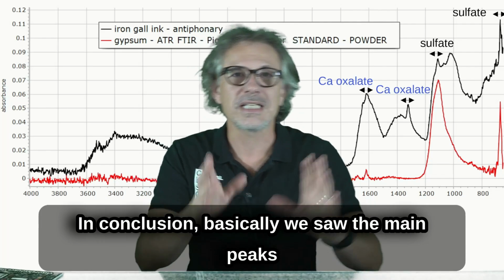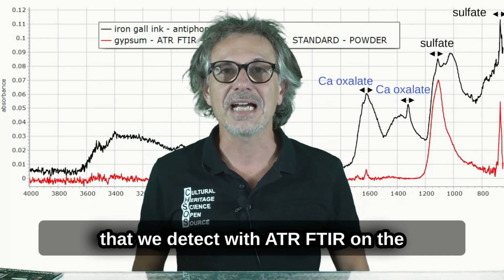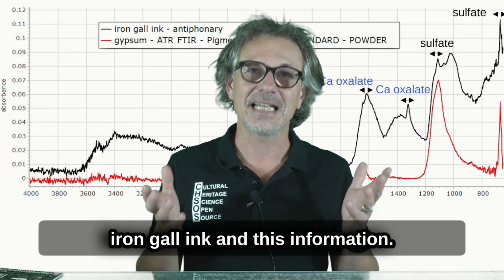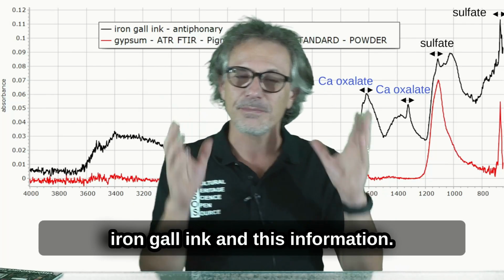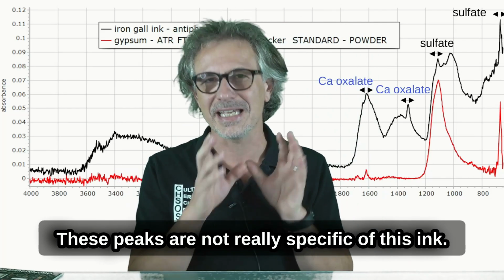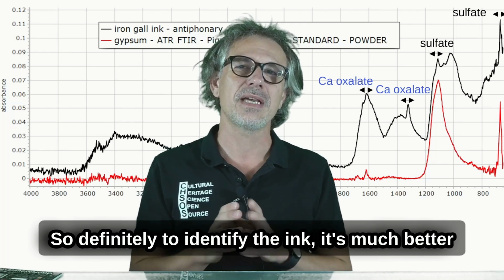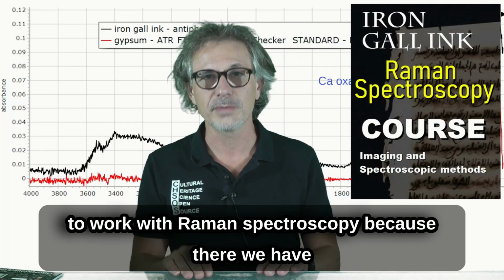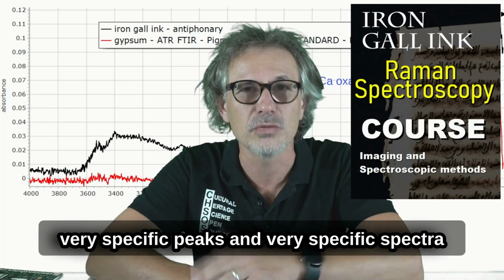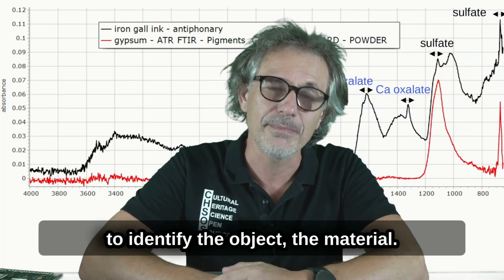In conclusion, we saw the main peaks that we detect with ATR FTIR on the iron gall ink. This information, these peaks, are not really specific to this ink. So definitely to identify the ink, it's much better to work with Raman spectroscopy, because there we have very specific peaks and a very specific spectrum to identify the material.